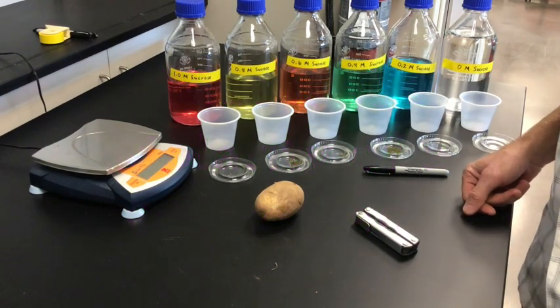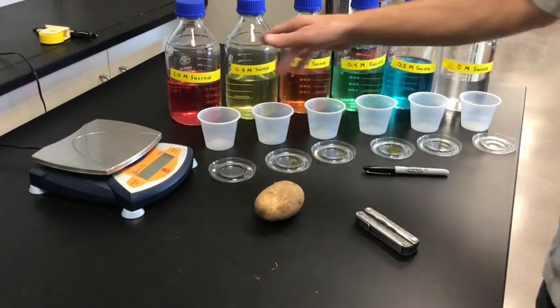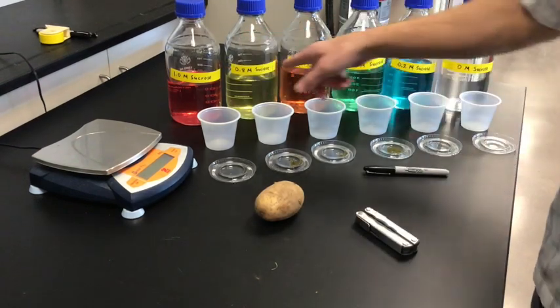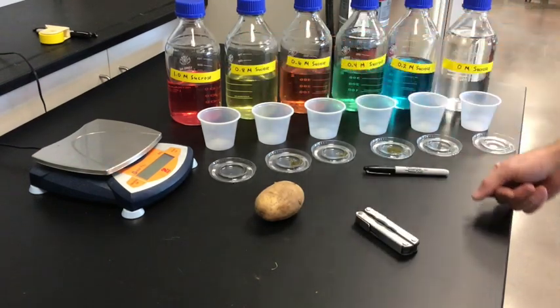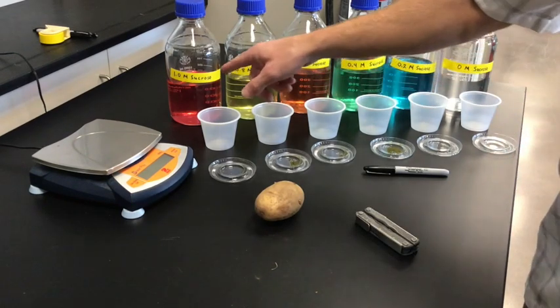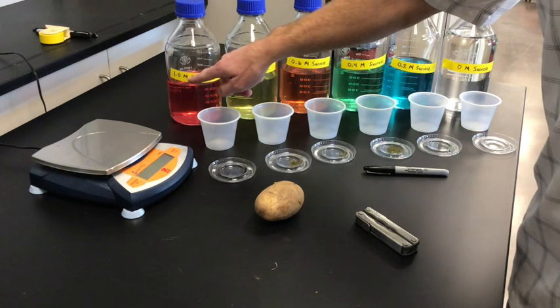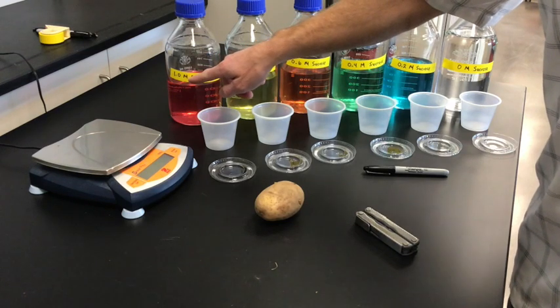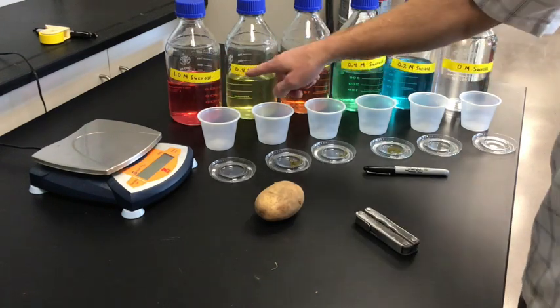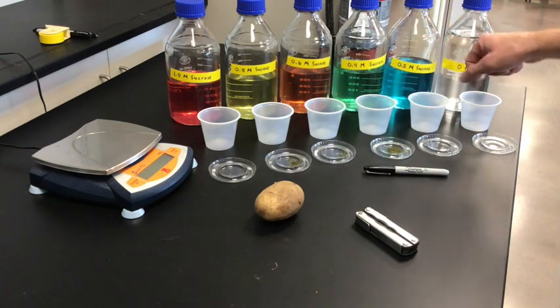In order to do that, I've got some concentrations of sugar water, or sucrose, already made up in increments from 1.0 molar to 0 molar: 1.0, 0.8, 0.6, 0.4, 0.2, and 0.